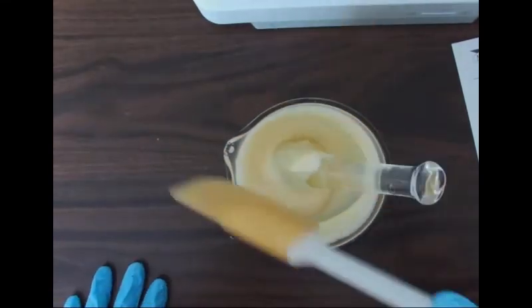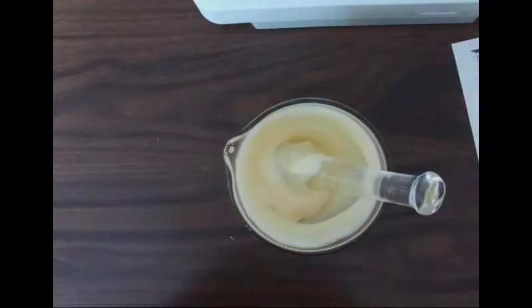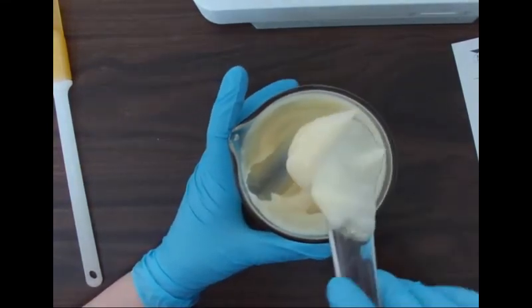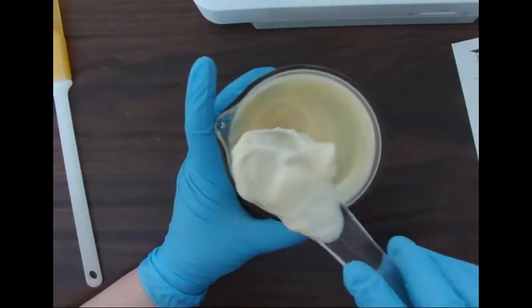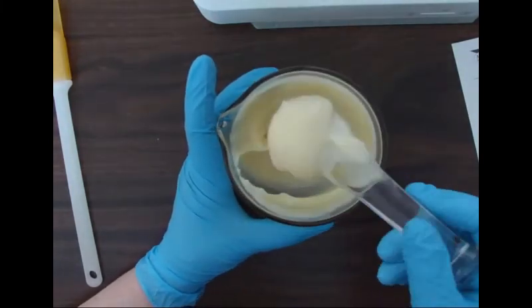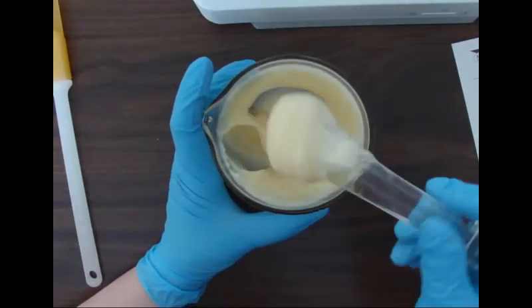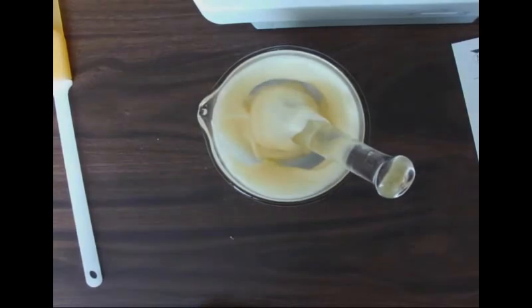Okay. Now, I didn't show you the packaging here, but it would be very similar to your foot ointment. We're just going to scrape out all of the contents there, making sure to clean up our pestle very good with our rubber spatula. But it will hold its shape pretty well, so I would try and do a little bit of a more on-purpose finish when we've got it in our ointment pot.